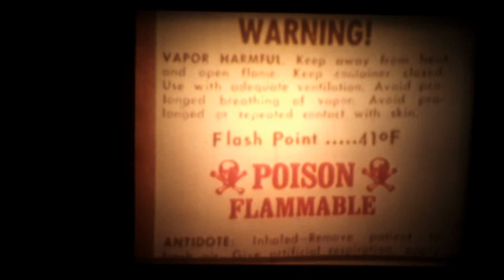For example, everyone needs to know the label means that the chemical has a low flash point. It's got to be kept away from heat, sparks, and open flames. That label also means that you must not smoke around this chemical. It means you have to keep the container closed, and you shouldn't store it near oxidizing materials. They support combustion.